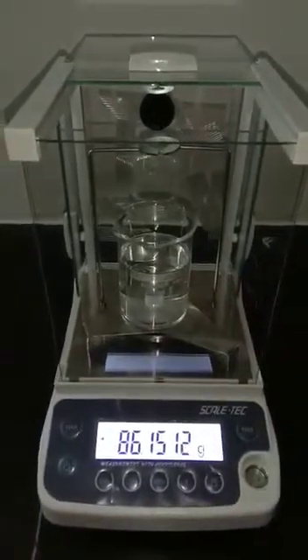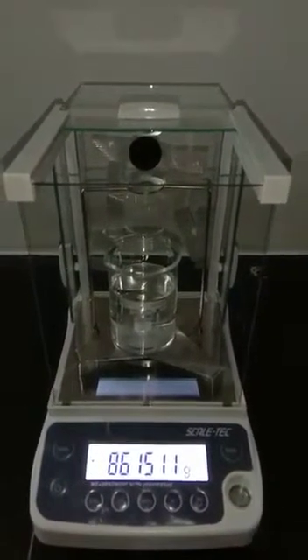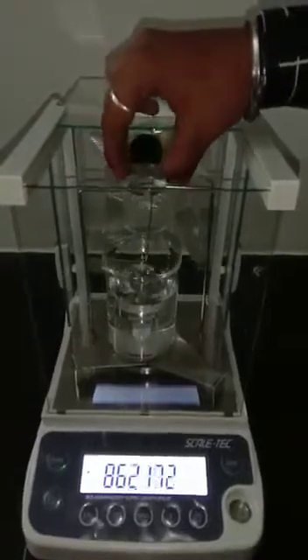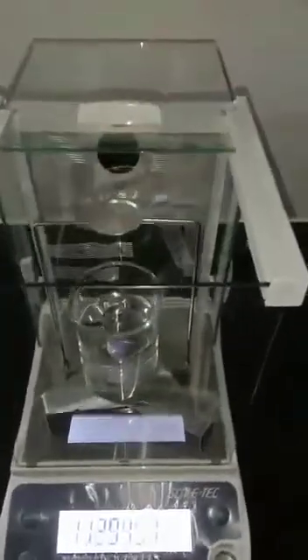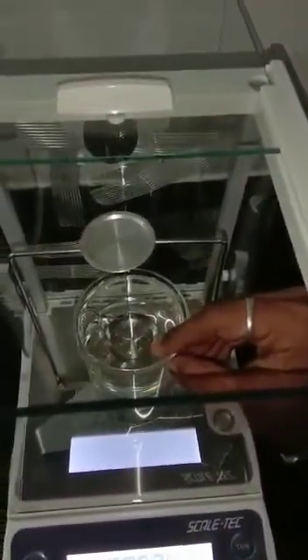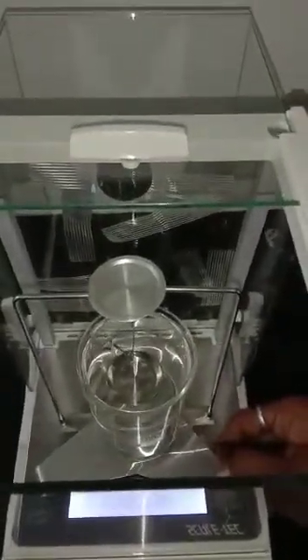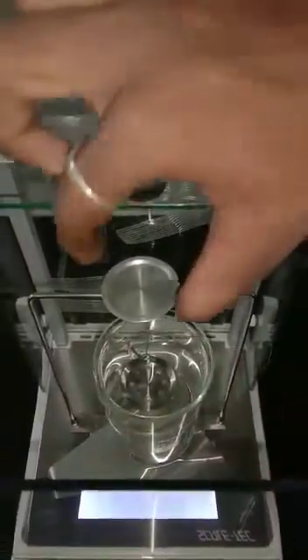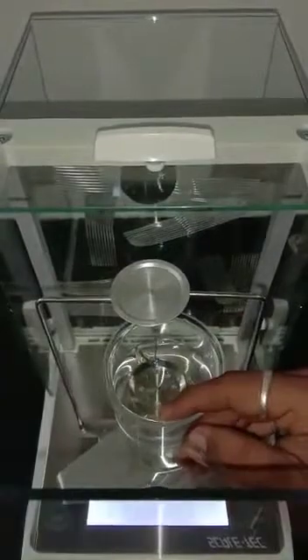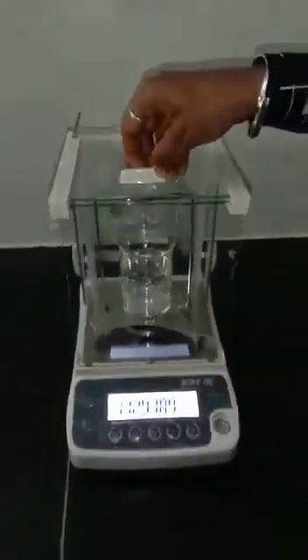Now, at the end, there is a hanging plunger. From the top side, put the hanging plunger inside the beaker and make sure that the hanging plunger does not touch the beaker inside the water. This precaution has to be done.